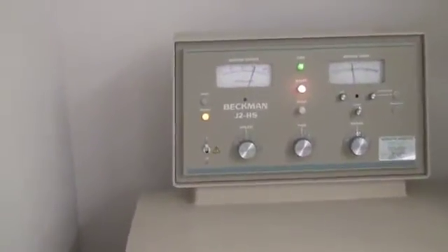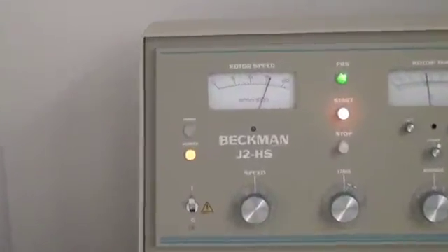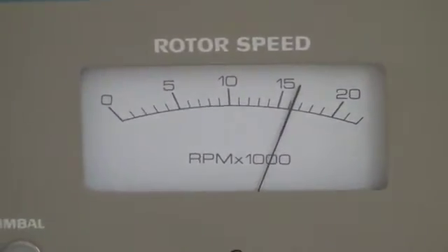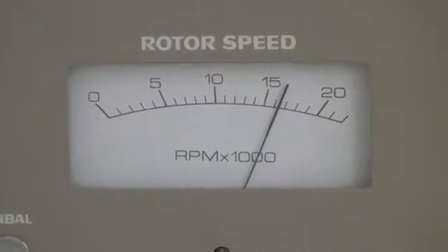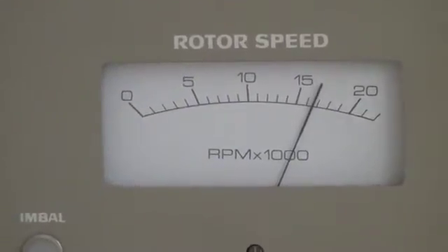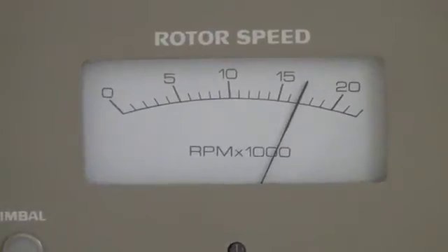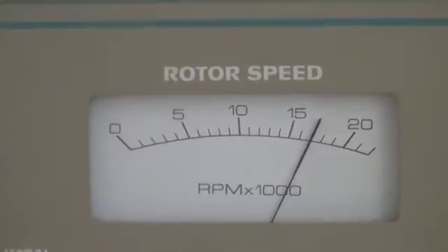I should point out that the important goal is to remove the insoluble debris, such as cellular membranes or organelles, which are denser than the aqueous solution. Such particles will have a greater force of centrifugation over the force of buoyancy because they have a greater mass than the mass of the solvent that it will displace.